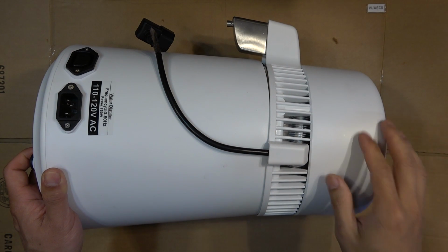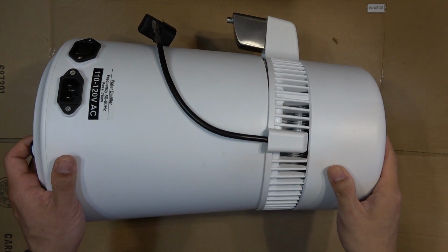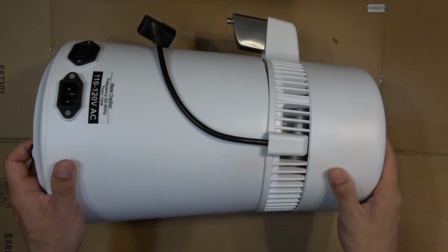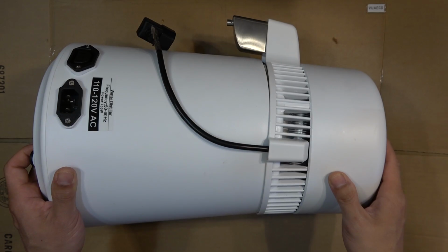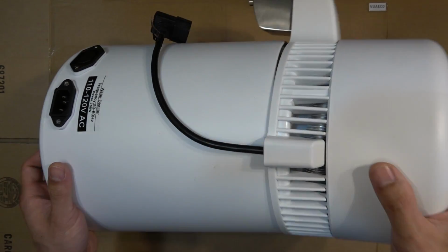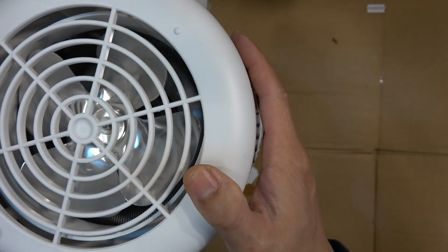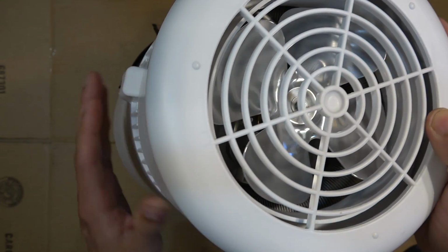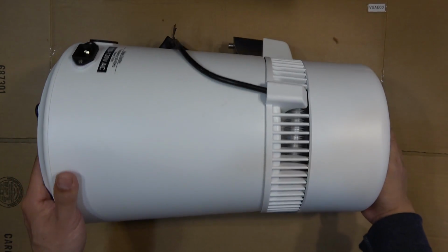Today I'm going to do a tear down of this eBay water distiller and show you what's inside. I just did a review on this distiller and it ran really efficiently. I was able to get almost 100% of the distilled water out of this machine. So I'm curious to see what's inside this machine and find out how it works.